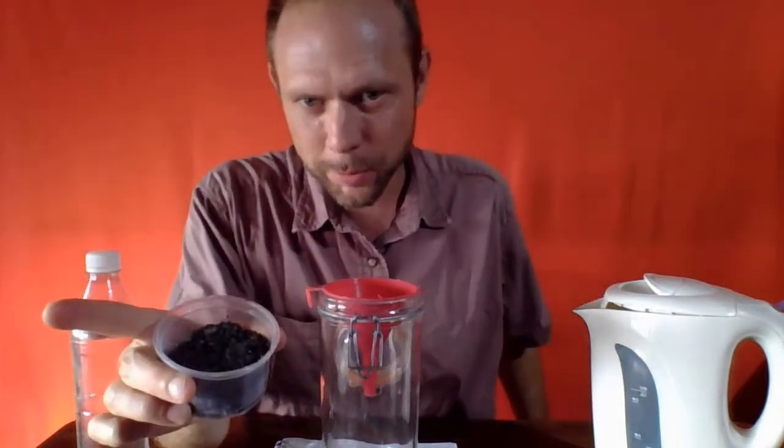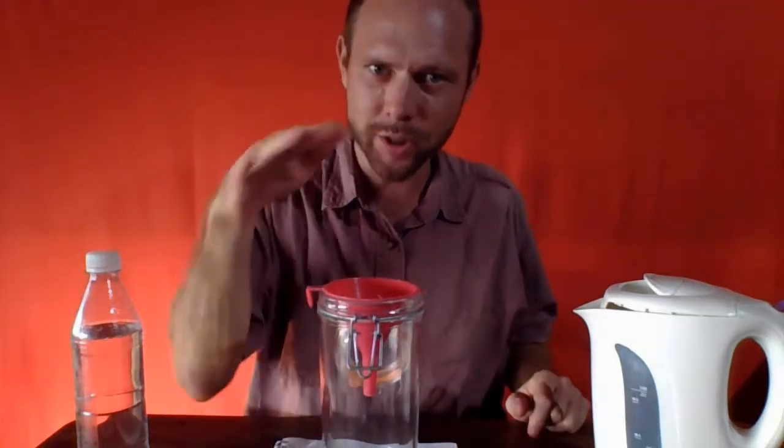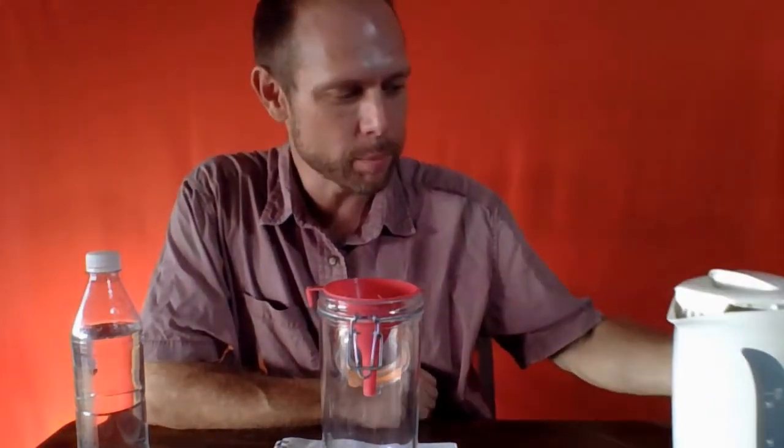Now, a little thing about this sand, it's really, really fine, and I found if I tried to dissolve the salt, it took a lot of water. The sand was then sticking to the sides of the biggest container, and to kind of clean everything out, I ended up really using a lot of water. So we're going to have a slightly modified approach here, and then I'm just going to put this mixture into the filter, the sand and the salt directly, and then I'm going to pour not cold water but some hot water that I've boiled in this electric kettle. I'm going to pour some hot water down through.